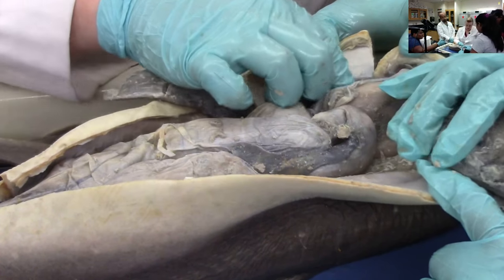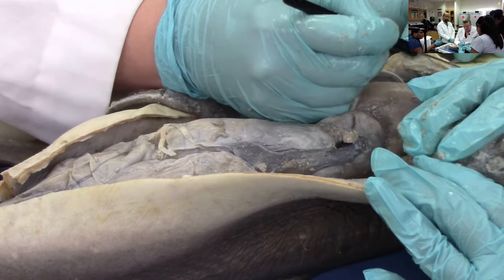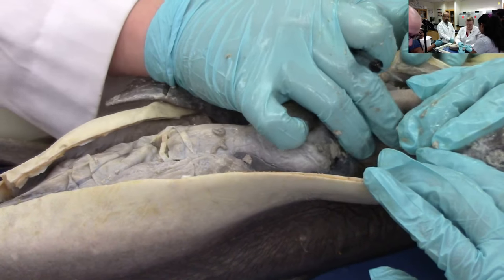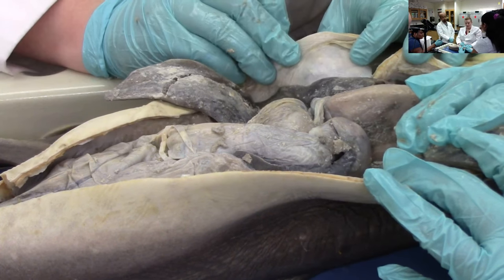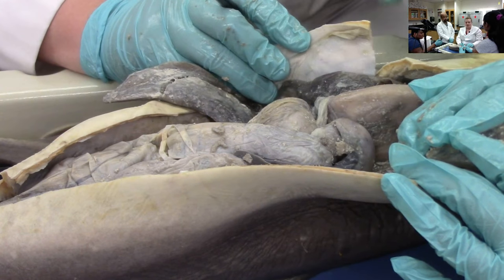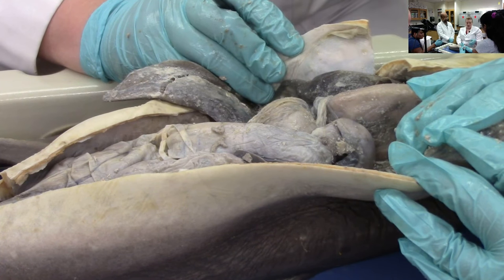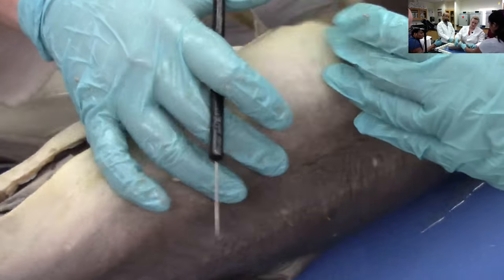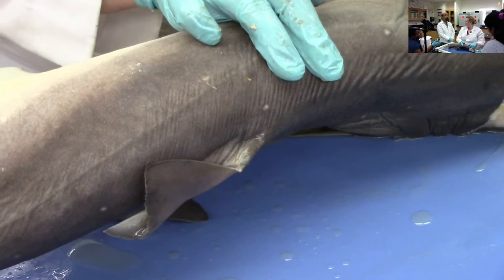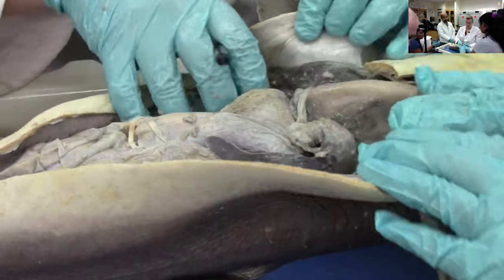There's a little piece of ligament up here that connects the liver to the ventral body cavity — it's called the falciform ligament, just as in humans. One thing that's really cool when you dissect organisms across different phyla — sharks, pigs, salamanders, cats — is you see a lot of anatomy that's conserved. It's got the same name; it's the same structure developmentally. They have this muscle right above the gills that is the same muscle as your trapezius developmentally.